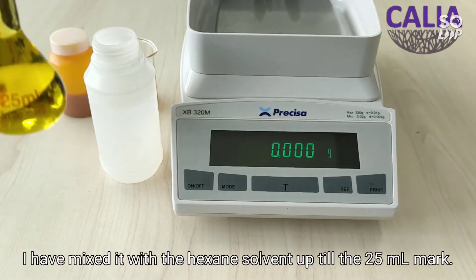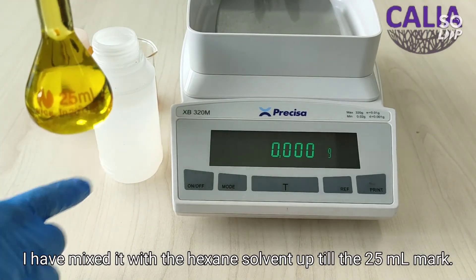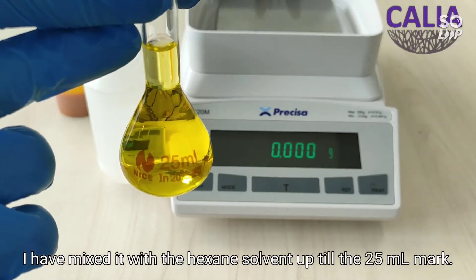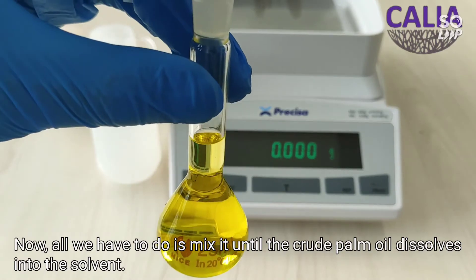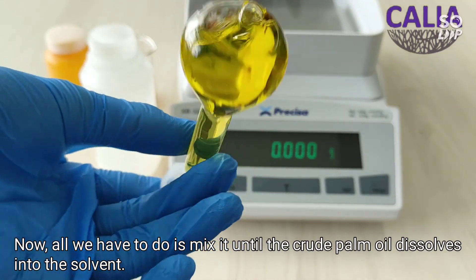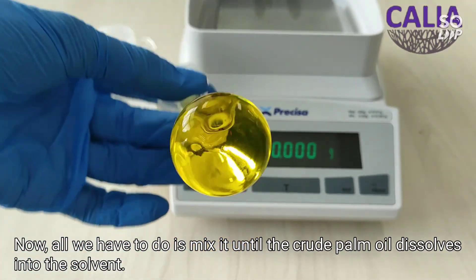I have mixed it with the hexane solvent up till the 25 milliliter mark. Now all we have to do is mix it until the crude palm oil dissolves into the solvent.